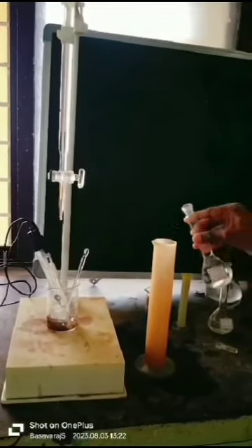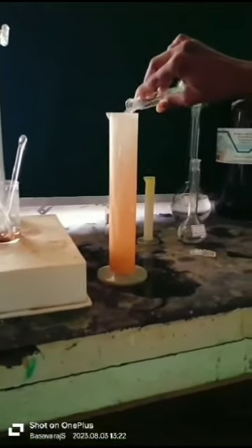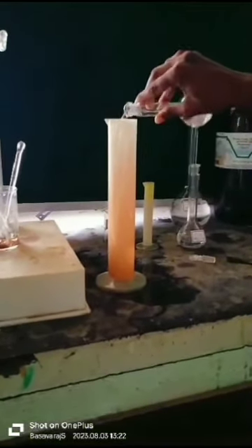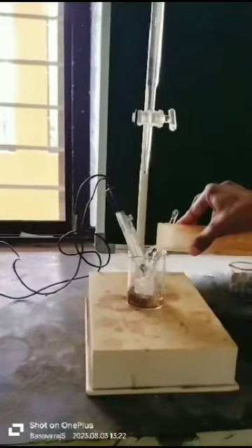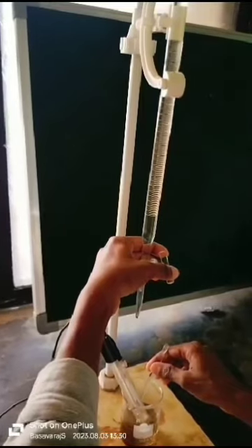Fill the burette with 0.1N NaOH solution. In a beaker, add 10mL of 0.1N orthophosphoric acid and then add a pinch of quinhydrone. Dip the two electrodes into this solution.